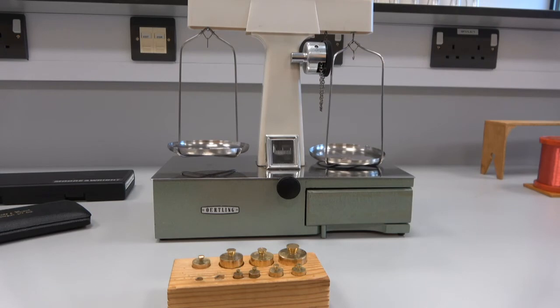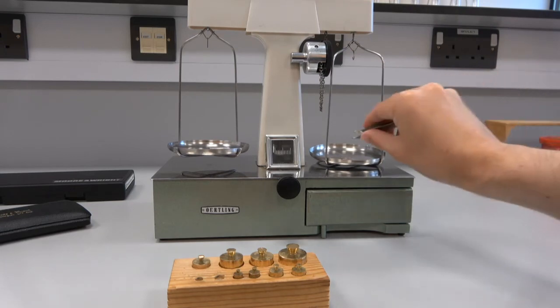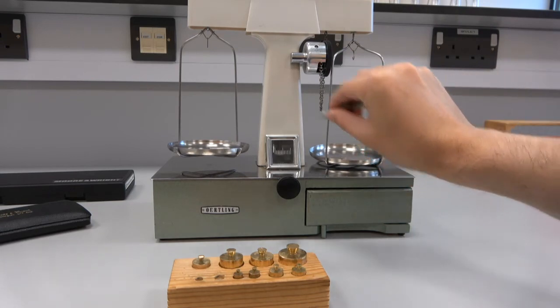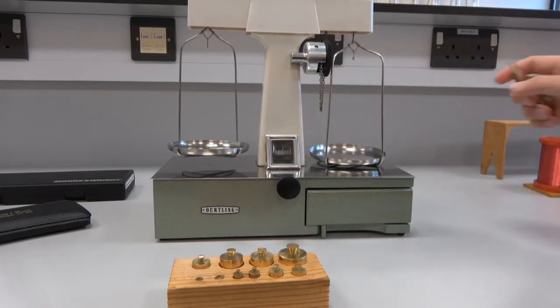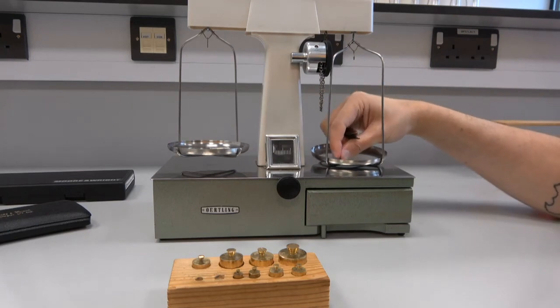So I'm going to put one gram on now. Ah, what a shock. So we've now got three grams on this pan, and three grams is too heavy, but two grams is too light.